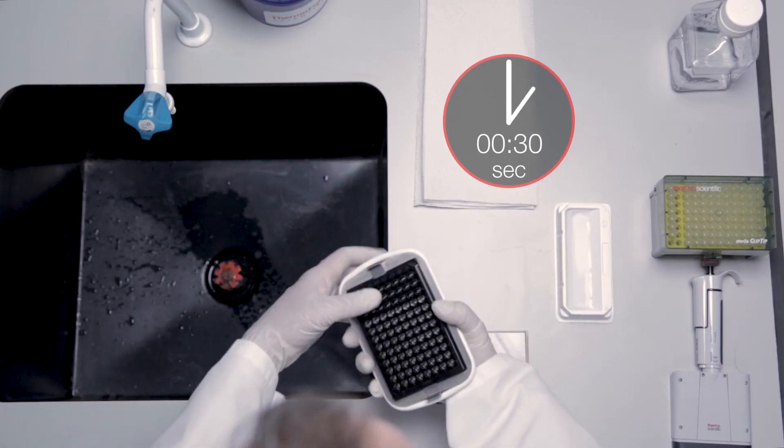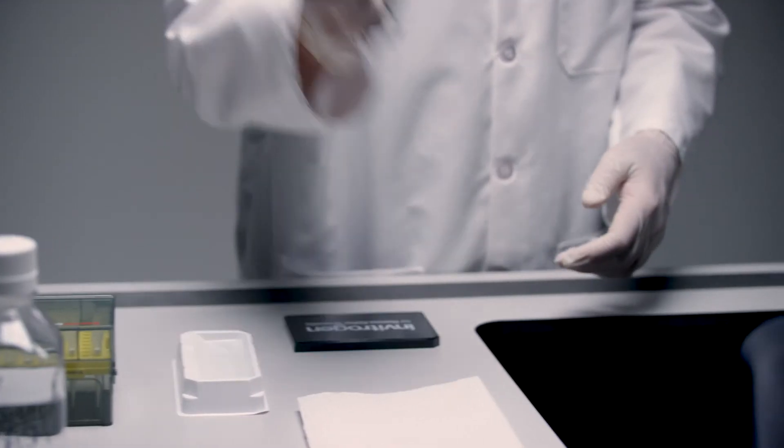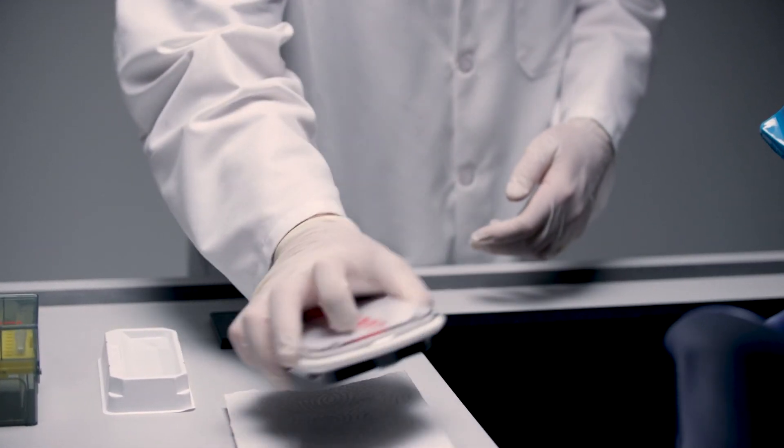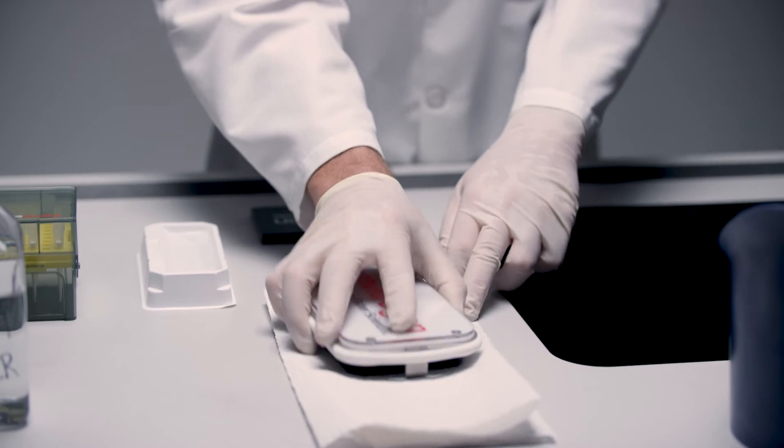After 30 seconds, quickly invert again over a sink or an appropriate waste container and blot to remove residual wash buffer from the wells.